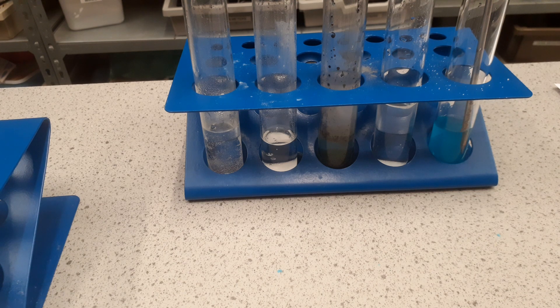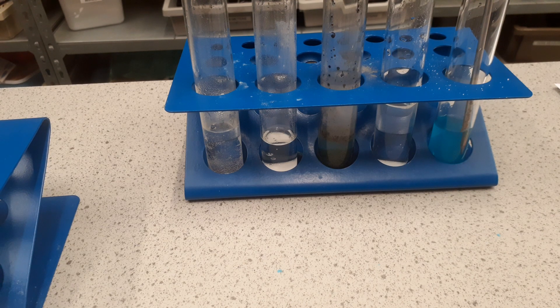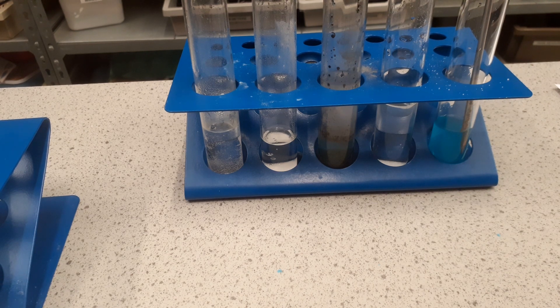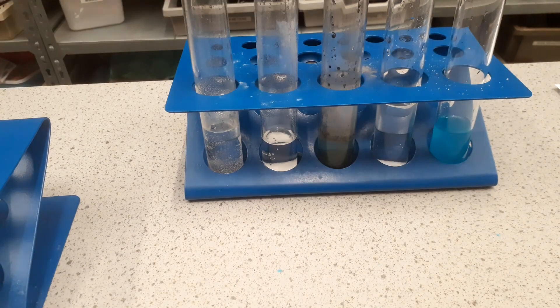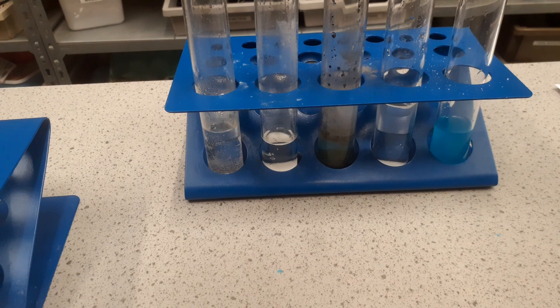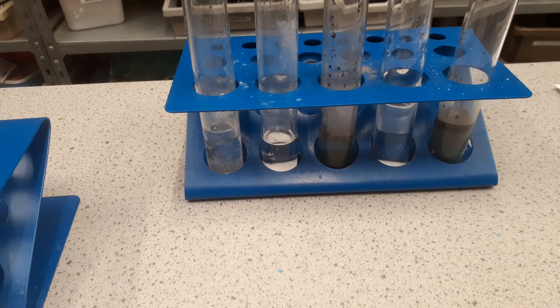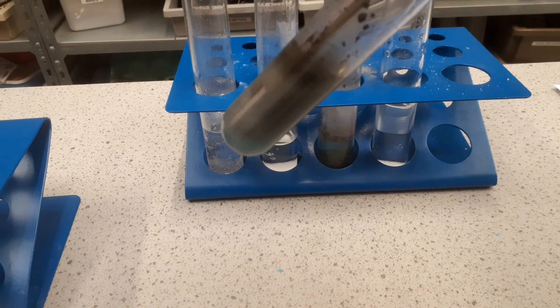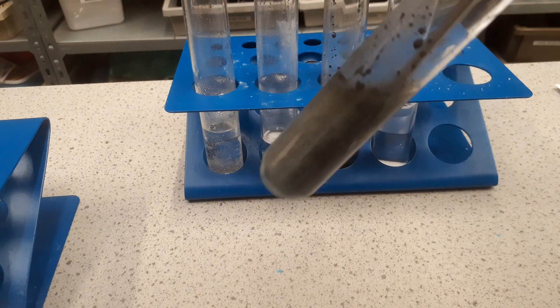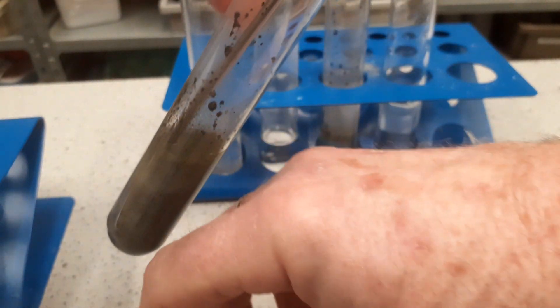Our fifth and final one - looking at our demonstration again. We're going to use copper sulfate and magnesium powder. The temperature has gone back to 18.1 degrees, as you'd expect. I'm going to add two spatulas of magnesium to it and stir it. As you can see already, the temperature is rising - it's up to 37, 38 degrees. A very vigorous reaction here.